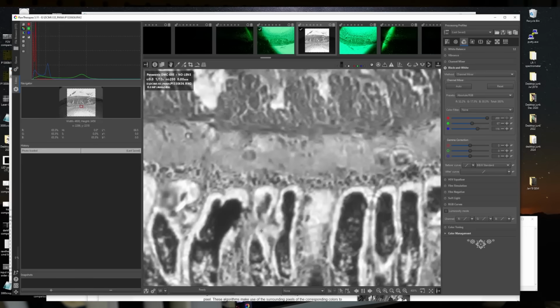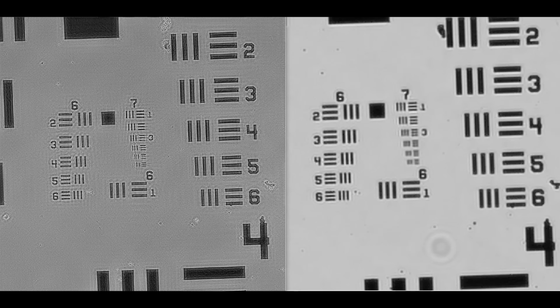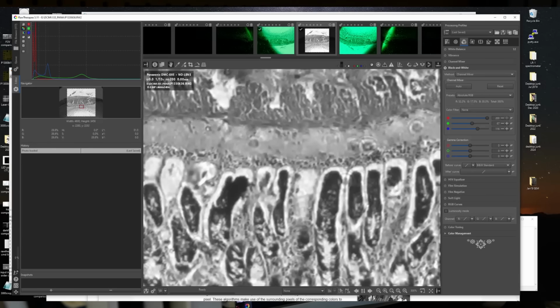It does seem a little weird. A green LED actually registers in both the red and blue channels on the camera, but it's true. It's not quite as sensitive. You can see there's a pretty big difference, but it does work, and it works well enough to basically allow this technique to function on certain images. Like that Air Force target, the resolution target works, but this tissue sample does not work. It's too complicated. I could not get this to reconstruct.